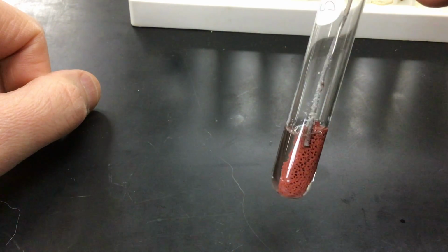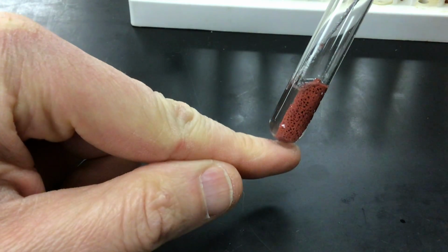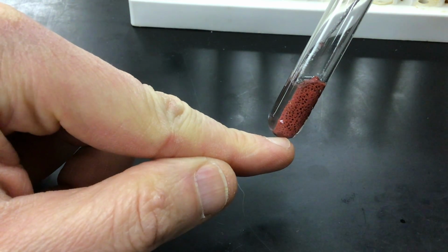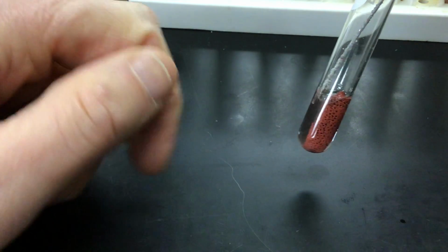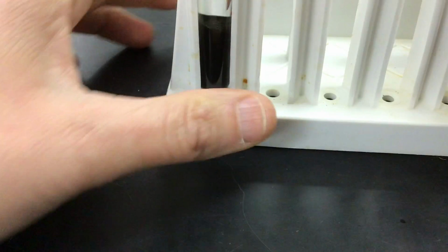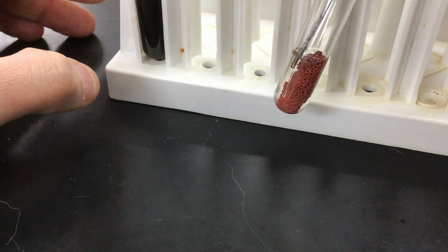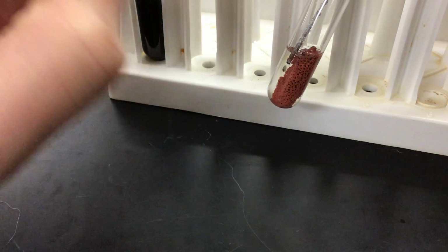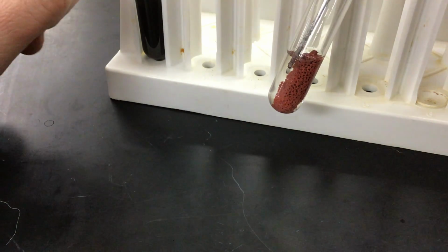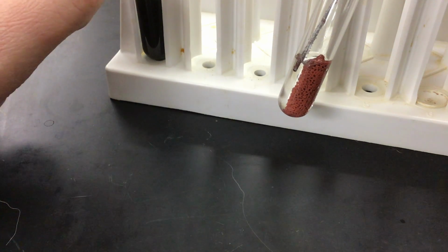So here we do still see the piece of aluminum inside of it, but the copper compound now has become this red material there. And there's also a clear, colorless solution that is formed. Right there, you get a good look at that. So that is the color and the state of the substances that remain. Again, there's the piece of the aluminum wire that has not reacted. There was more than enough aluminum wire added to this vessel, but there are the products of step 5.